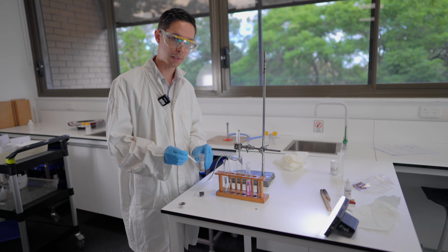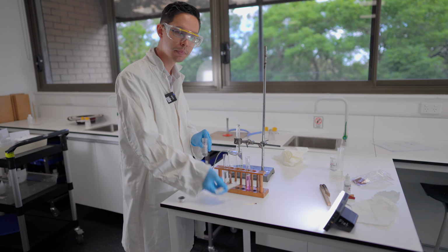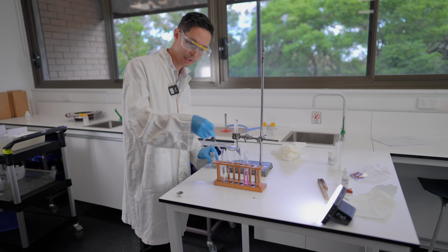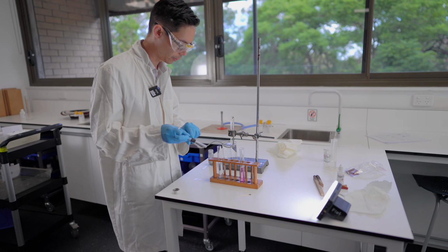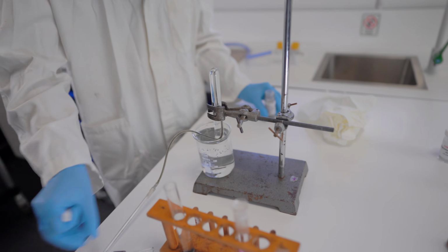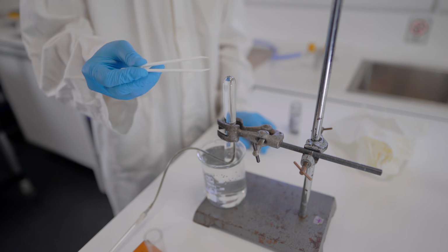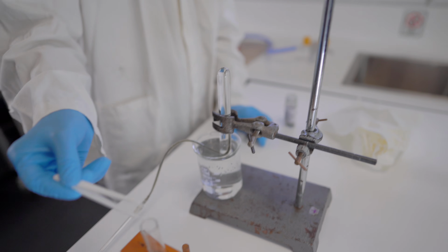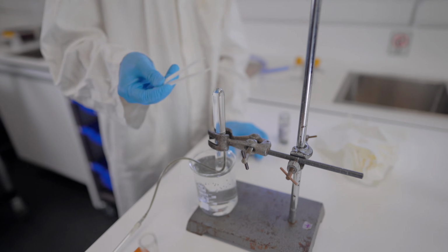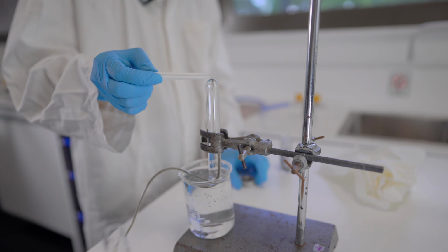This time we're going to try and capture the gas being produced, the little tiny bubbles we saw with magnesium. As soon as I drop some in, I'm going to plug it with this rubber bung with a hole through it, and we've got a pipe that leads to a test tube. This whole test tube is filled with water all the way to the top. As I produce gas, we're going to funnel it underneath and into this inverted test tube, so any bubbles that are made will start to collect here one by one.